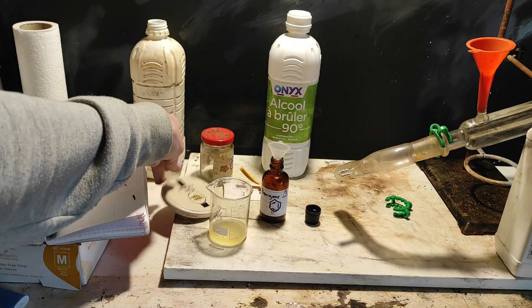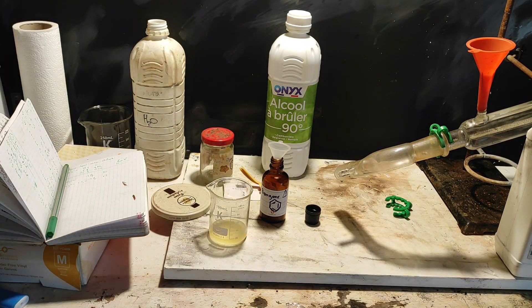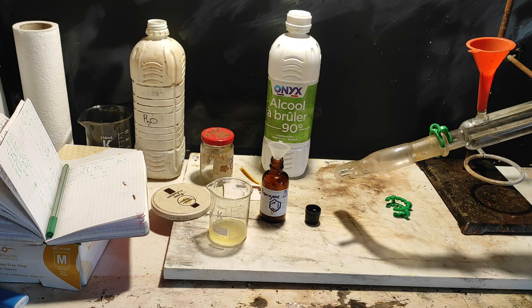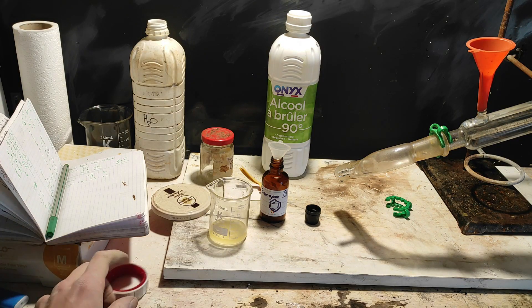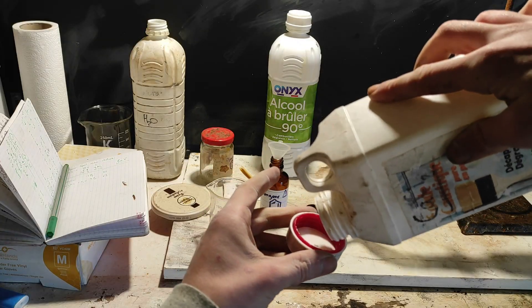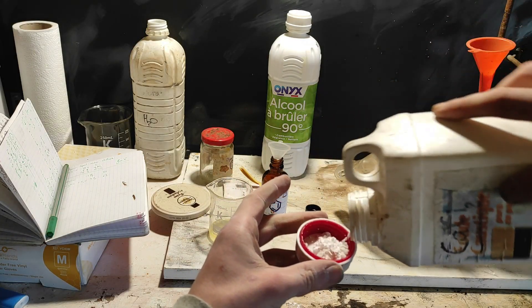And what I think I will improve, if I have to redo this procedure, is that I would put a real reflux setup for the hydrolysis of the PET. And I might try to purify it better before continuing. Anyway, don't leave yet, because I'm going to show you how to clean the flask as well.